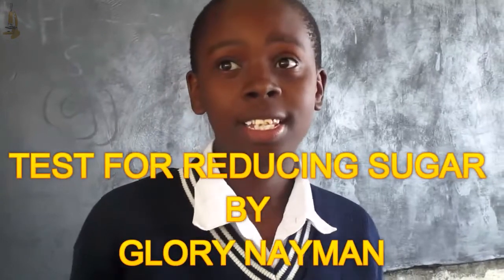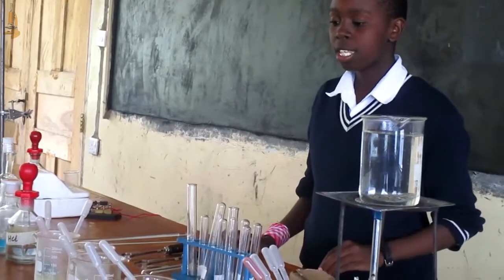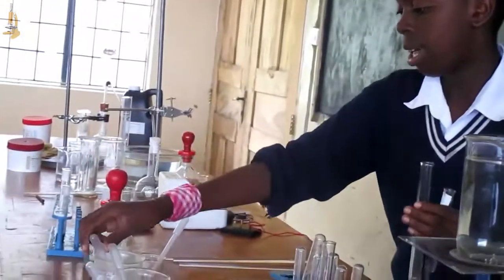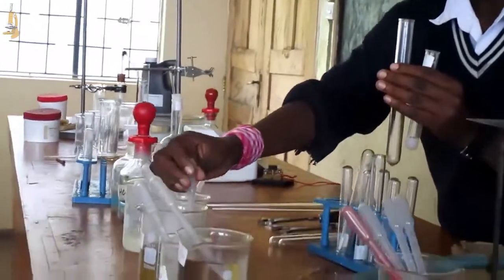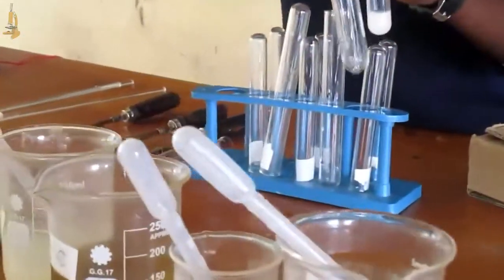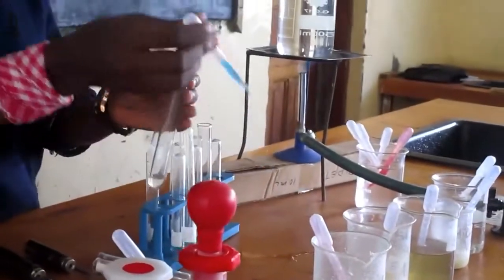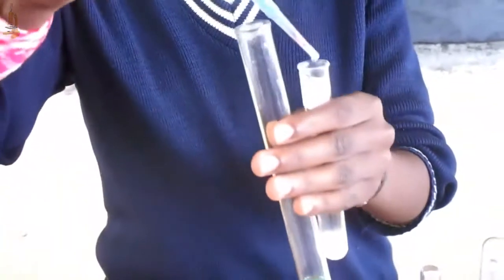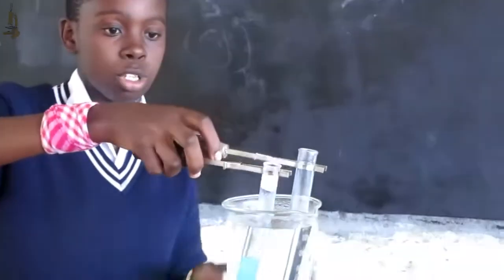I am a Form 2 student at Kisimiro Secondary School. Today we are going to do the test for carbohydrates. As we know, carbohydrates include reducing sugar and non-reducing sugar. I am going to test for reducing sugar. We take our test tube, then we take our food sample A and put it in our test tube. After that we take Benedict solution — the same amount as the food sample — and put it in our test tube.